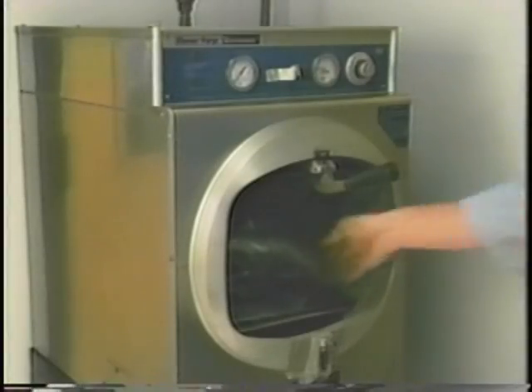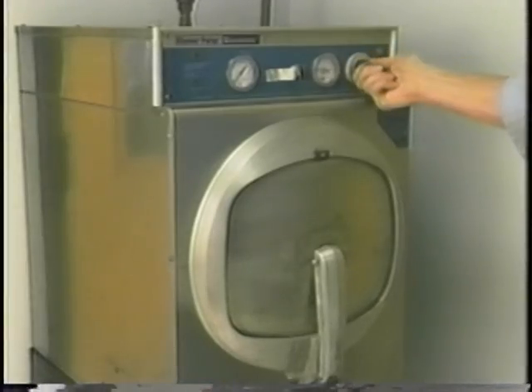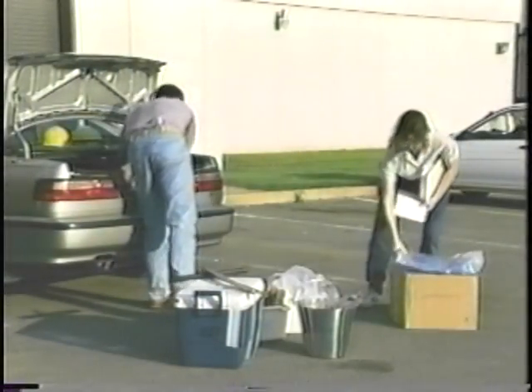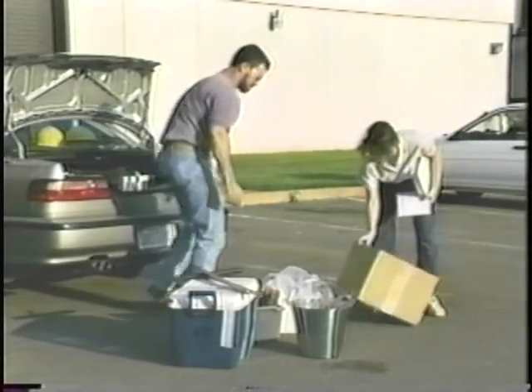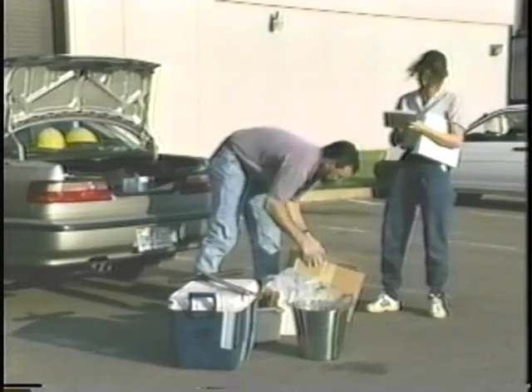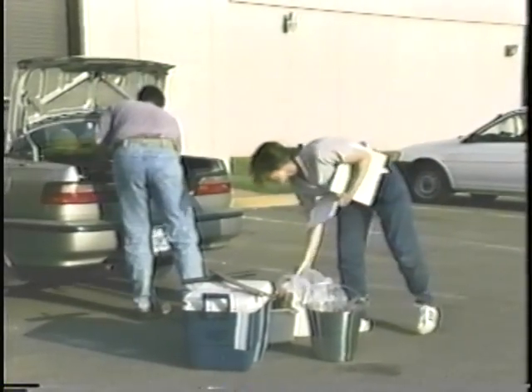If you are sampling for pathogens, you need to use sterile sampling equipment and containers. You also need coolers and ice, bubble wrap to protect any glass jars, labels, plastic bags, tape, markers, chain of custody forms, and seals. Ice is very important since it preserves the samples in the field.